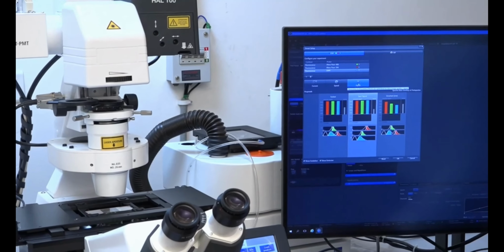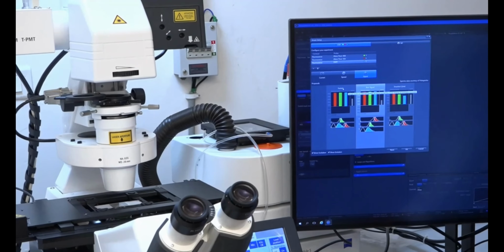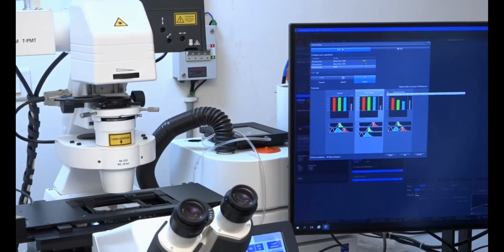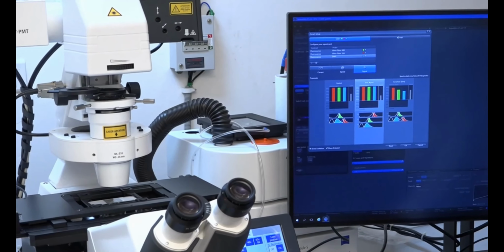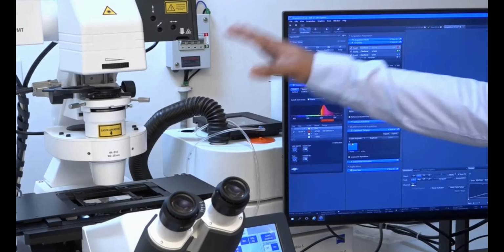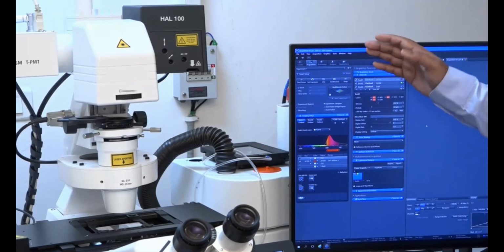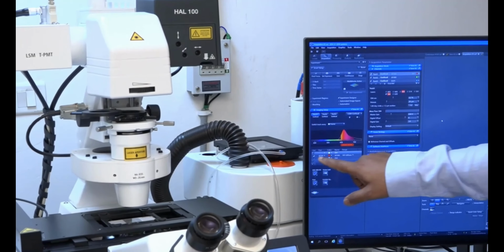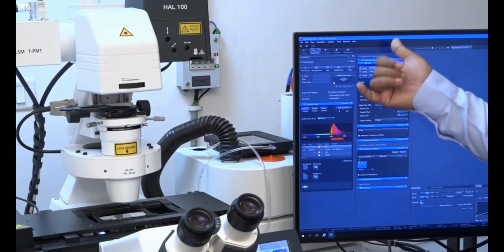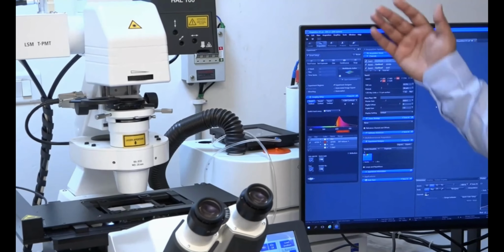So if you are interested in signal, you click onto the signal, and if you want fast imaging, you have a fast imaging option, you have the best signal, and you have the smartest one. So by convention, getting the best signal should always be the objective when you are working with a fluorescence sample. So now if you say OK, the system will automatically configure based on the 3 dyes which you have selected. So all the laser selections, the dichroic mirrors, the main beam splitter, they will all align based on my selection of the dyes, and it is fully motorized. So you just have to click. With a click of a few buttons, it is ready.